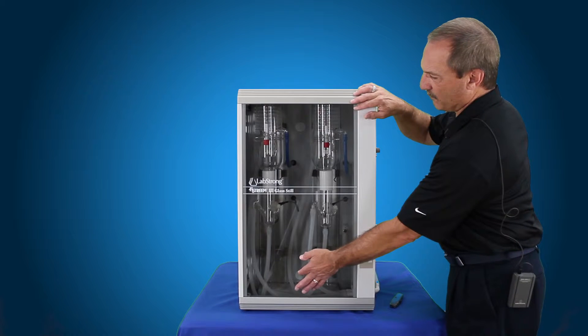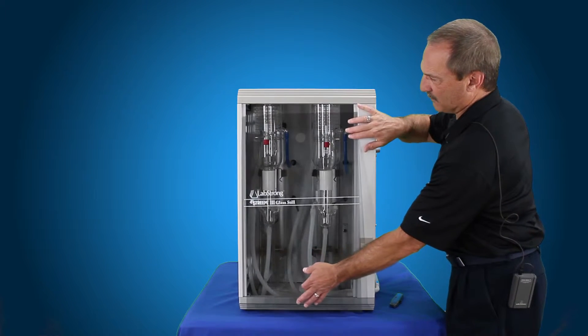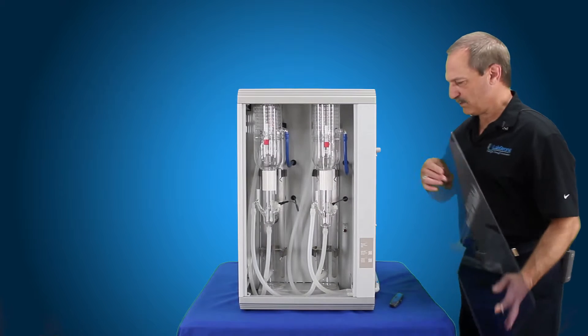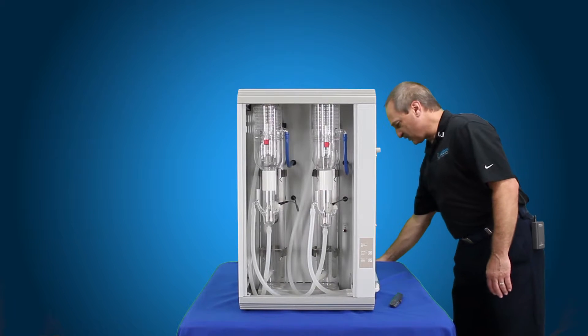The first thing we're going to do is remove the door by lifting up, pull out on the bottom and drop the top down. That removes your door and set that aside because you're going to reuse it.